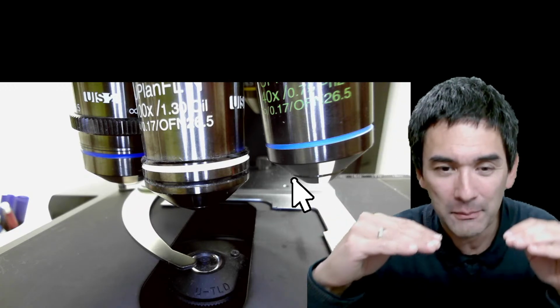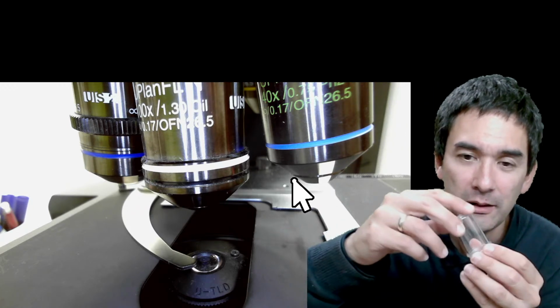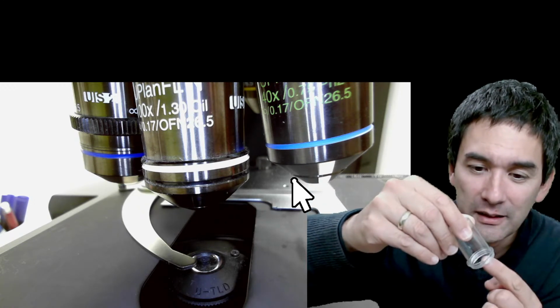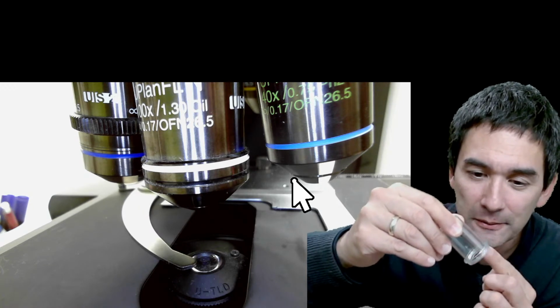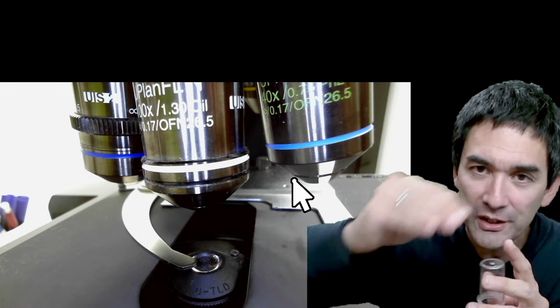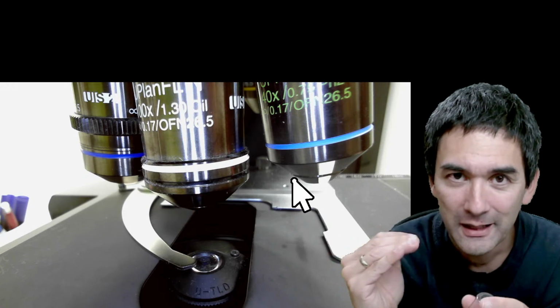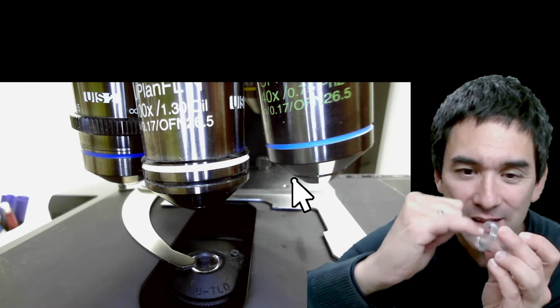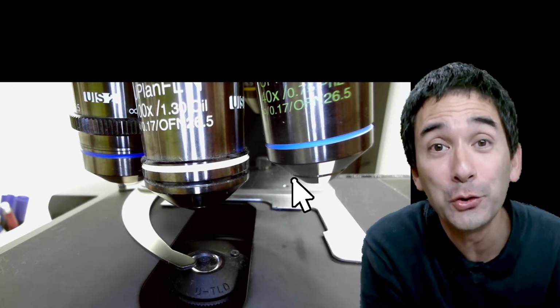Don't move it horizontally, but it's going to first, I'll use this here as an analogy. It's an exaggerated analogy. Basically if you crash it in, then the lens is further inwards, and therefore it's first going to crash here on the side. And because the front lens is concave, it goes inwards, it's sometimes difficult to clean it. Because the dirt is in there, and if you just wipe over it superficially, you're not going to catch the dirt that's inside. And so my sales representative told me don't be afraid.